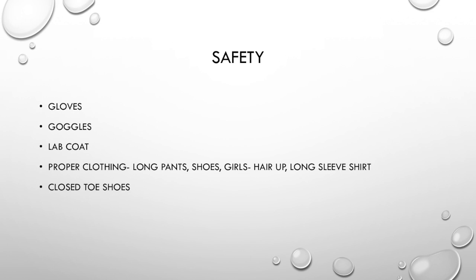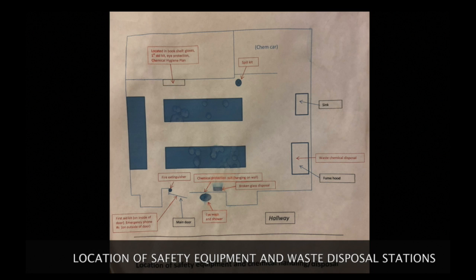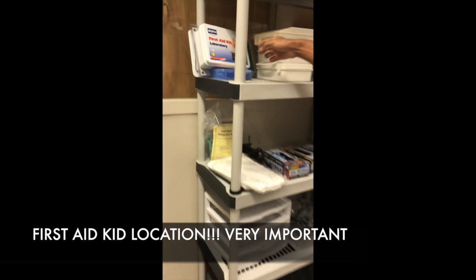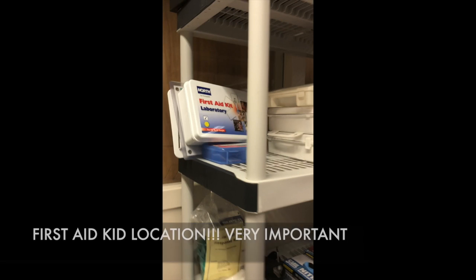When in the lab, it is important to follow proper safety procedures. This includes proper attire, protective equipment, and following protocols to ensure the safety of you and your classmates. Before going to your lab station, take note of where things such as safety equipment like your eye wash and waste disposals are. These can be found on your local safety map. Note the locations of your first aid kits. This one is located behind the door of the entrance. The next one is located towards the back of the classroom.